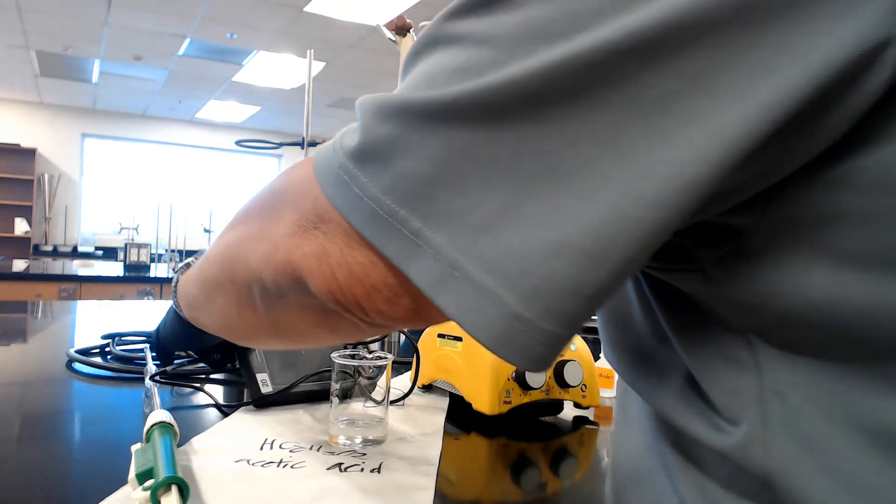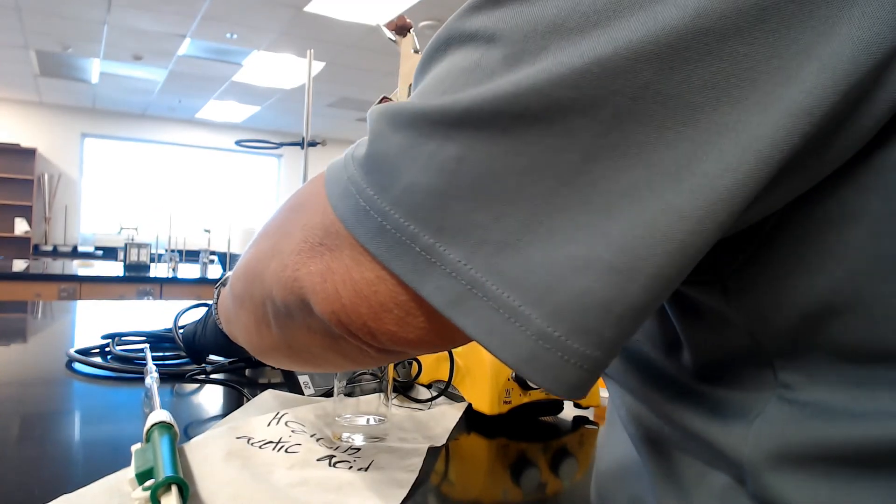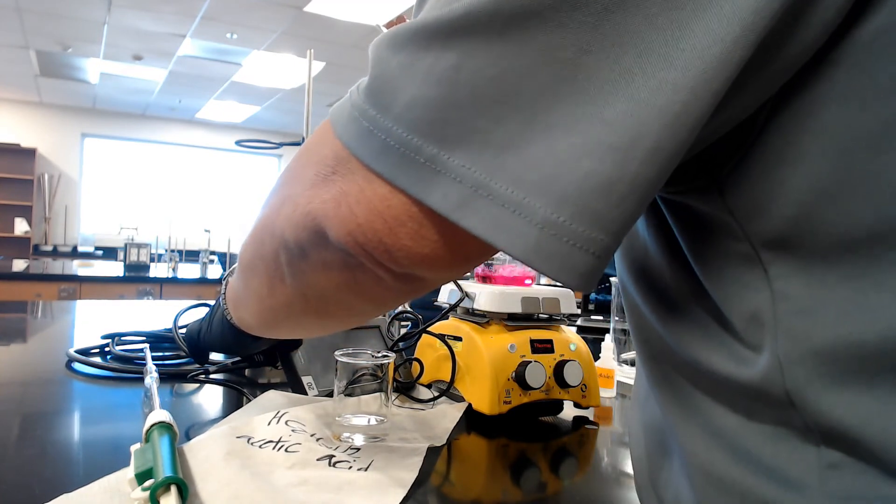Ten point five. Dr. Rochelle is reading the pH right now. Eleven. Eleven point five. Now I have to refill. Eleven point five. Eleven point two. Eleven point eight. Twelve. Twelve point three. And one more. Twelve point five. Twelve point eight. I'm done.